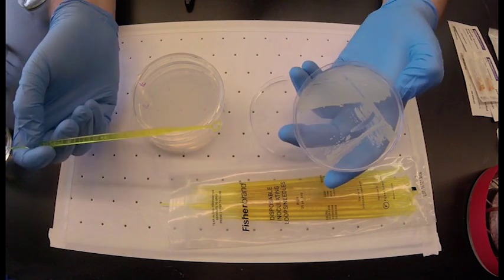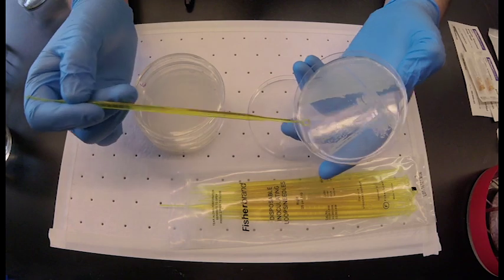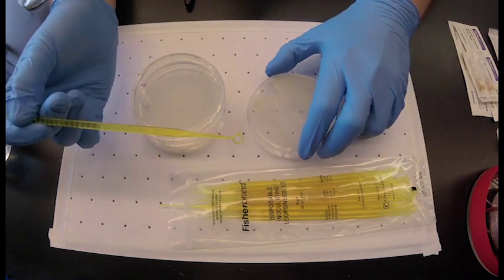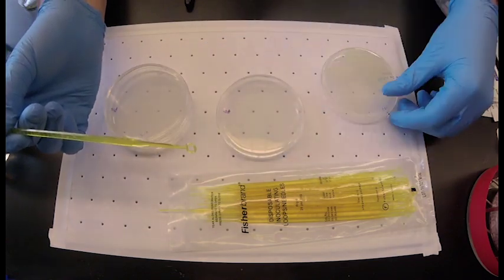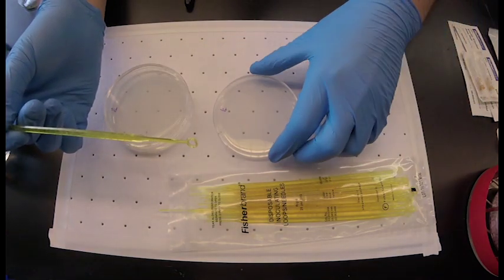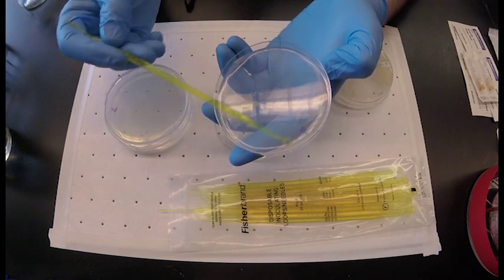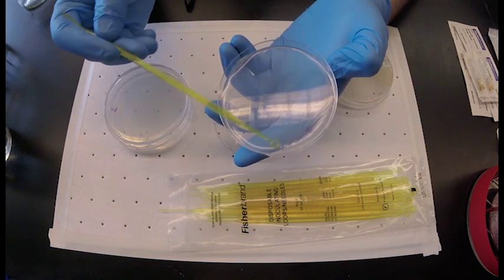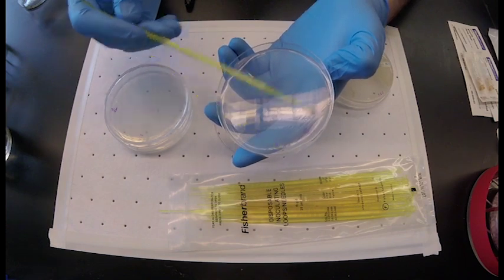Alternatively this can be done with a flame sterilized wire loop. Take the first colony and streak it on the plate. The idea here is to spread all of the cells in the colony over a small area.